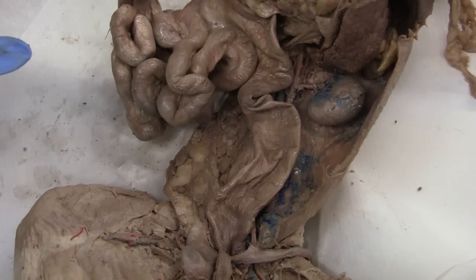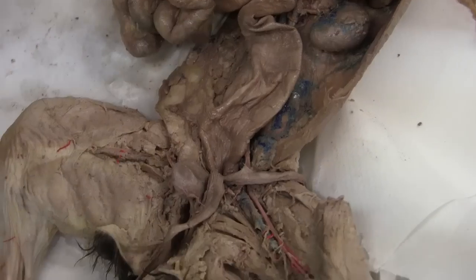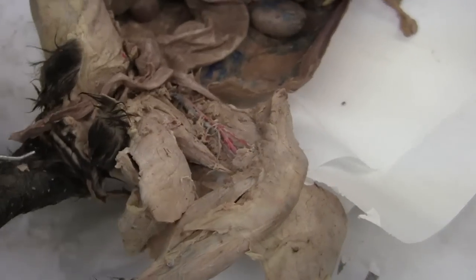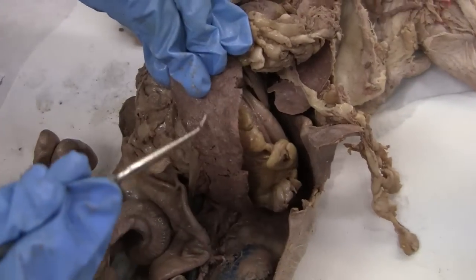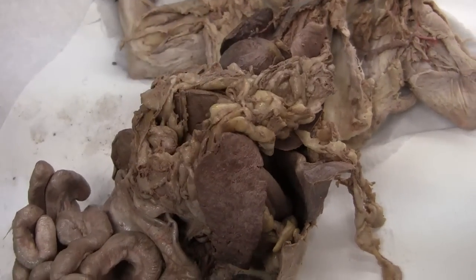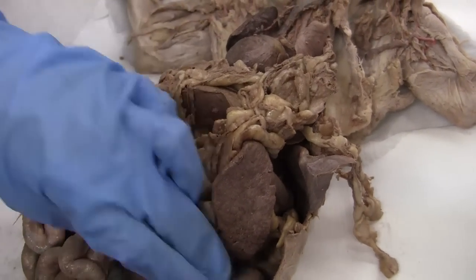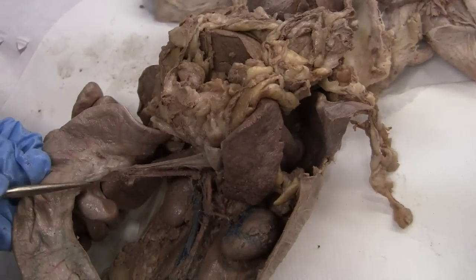Can you see the anus or the anal canal? No. If you lift up her legs, it's right under the tail. What about the spleen? Yeah, the spleen is this. Can you see the taenia coli? Kinda. You can kind of see the ribbons here.